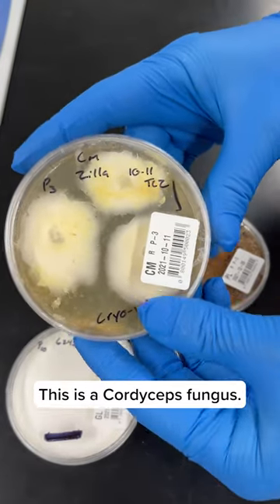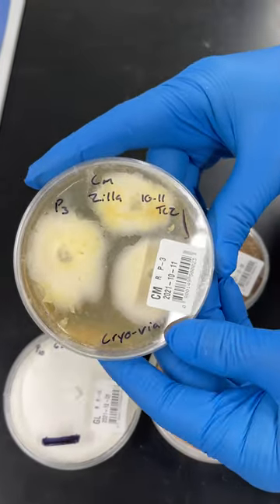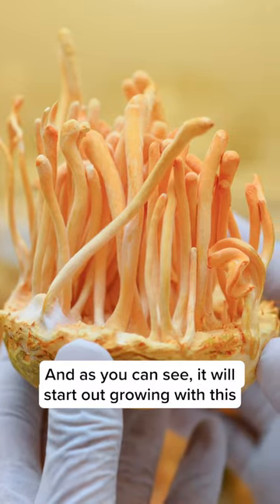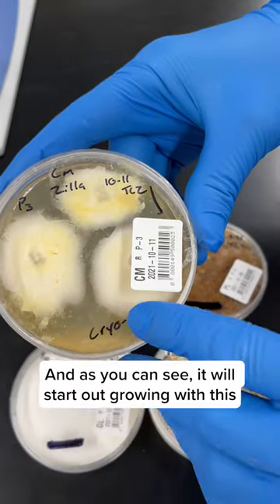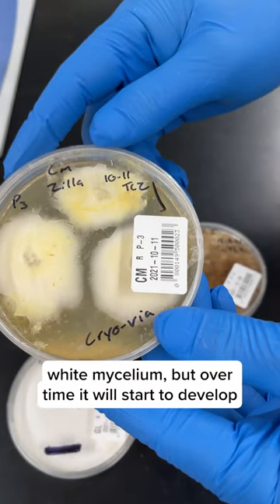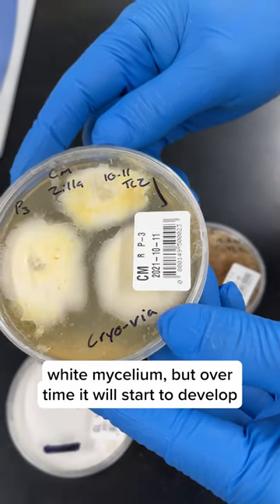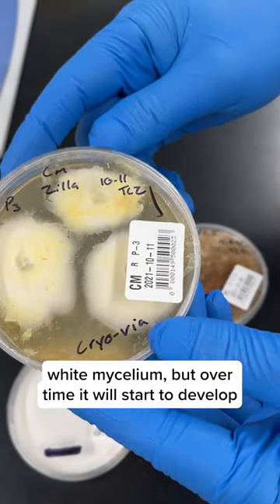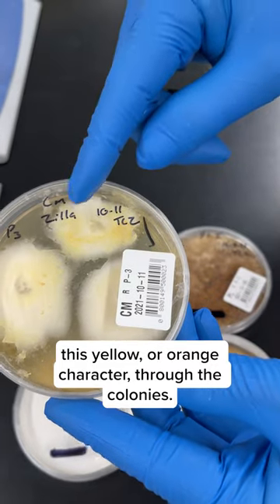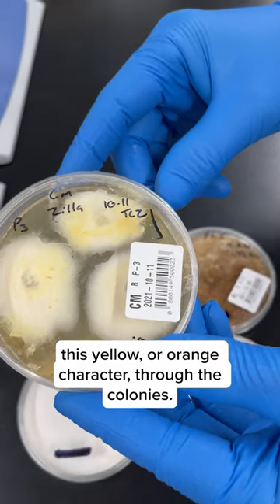This is a cordyceps fungus. As you can see, it will start out growing with this white mycelium, but over time it will start to develop this yellow or orange character to the colonies.